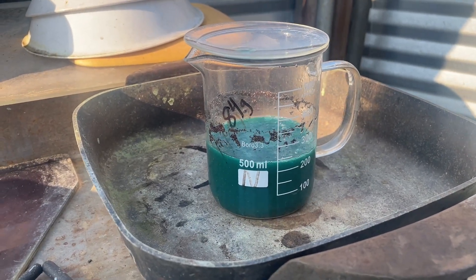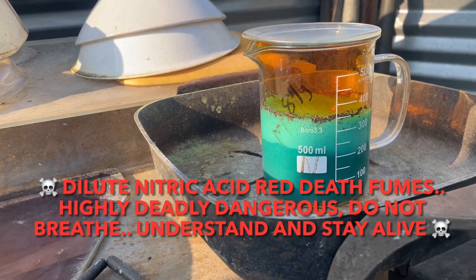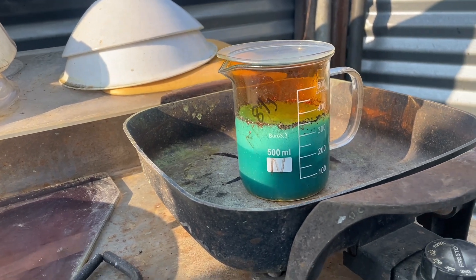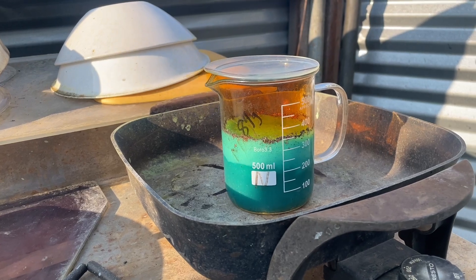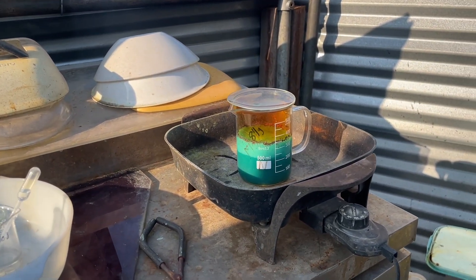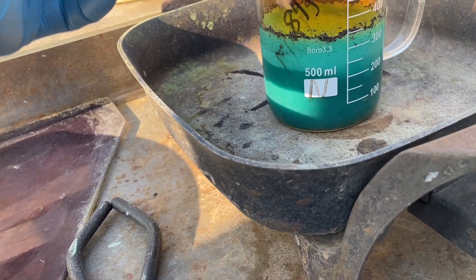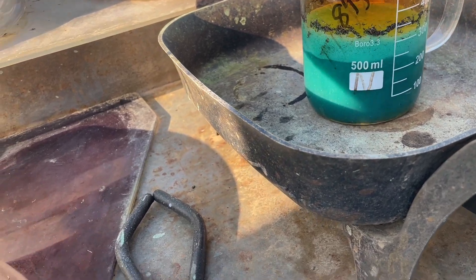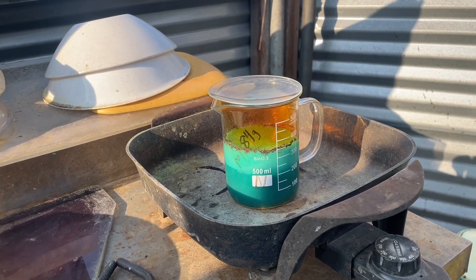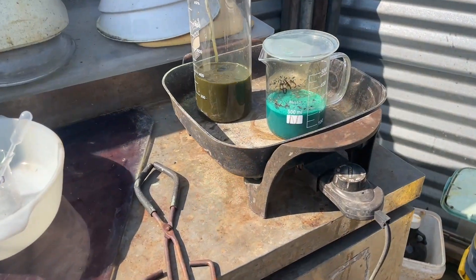Then I get that gold in solution, filter and drop it - let's see what we get. I got it dosed pretty hard right now. I put in very slowly about 12 milliliters over a three or four minute period, and of course it's getting pretty squirrely, so I took my foot off the gas pedal just for a little bit. Come down just a little bit, get all that solution, get all that metal burned up in that solution. I can do basically one full squirt like that without it flipping out too much. It'll come up a little bit and then go back down - just a few minutes to burn off those 3 milliliters.